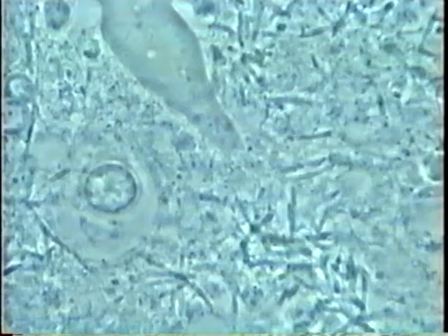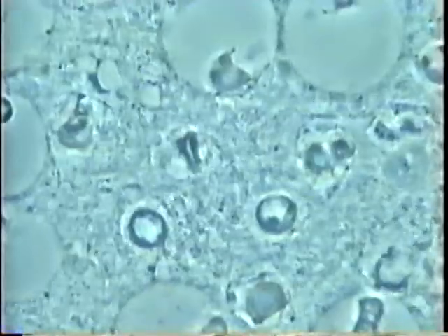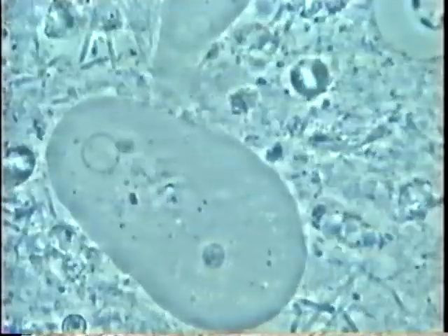Here we see a brush pattern with actinomyces filaments. Those amoeba usually like to stay under the filaments. This is a well-organized system. So it is a little incomprehensible that your dentist doesn't tell you about this infection, because this clearly is present in almost all active periodontal disease.